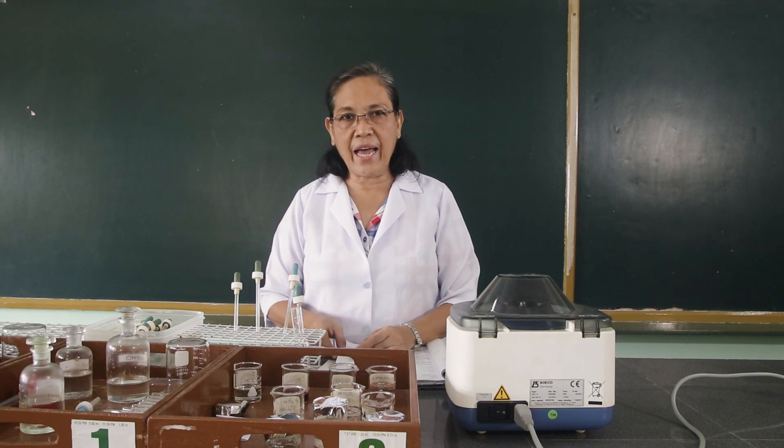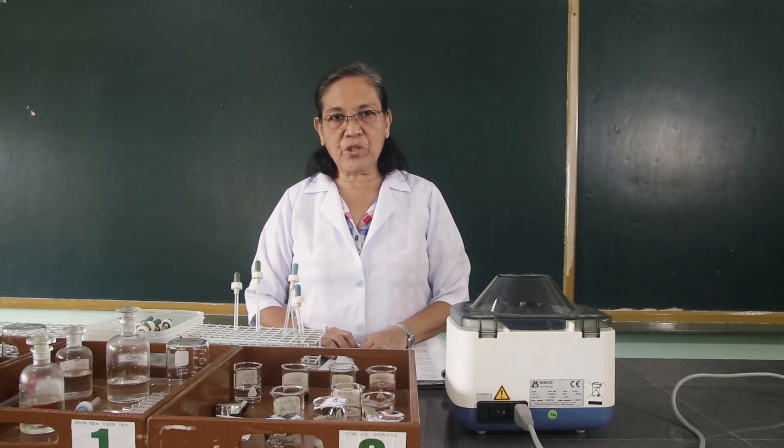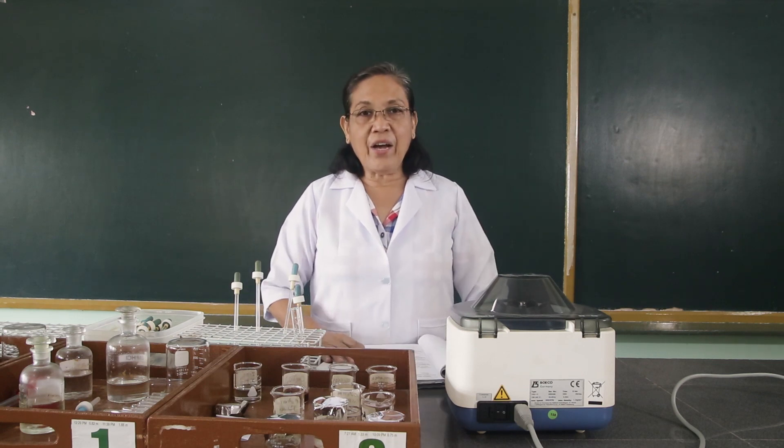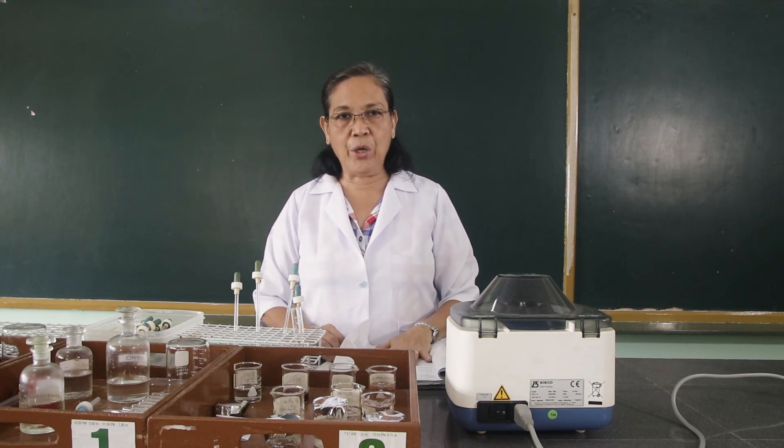Hi, good day. Welcome back to our class in Chemistry Laboratory. Today I will be performing a lab lecture on the analysis of Group 3 cations. What I would like you to do is to observe keenly, carefully, and write your observations and answer the questions in the lab guide. There are two methods used: the lengthy method and the shortcut method. So let's use the shortcut method, or the direct test, in testing these Group 3 cations.